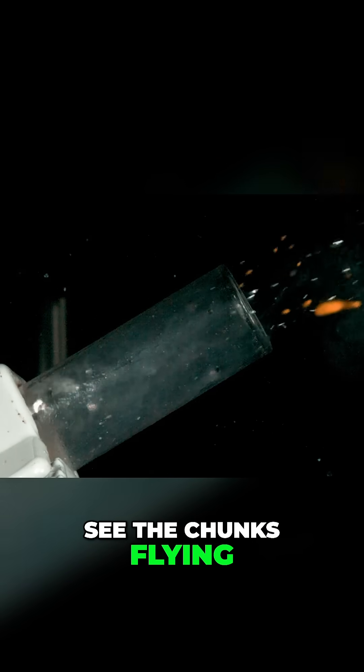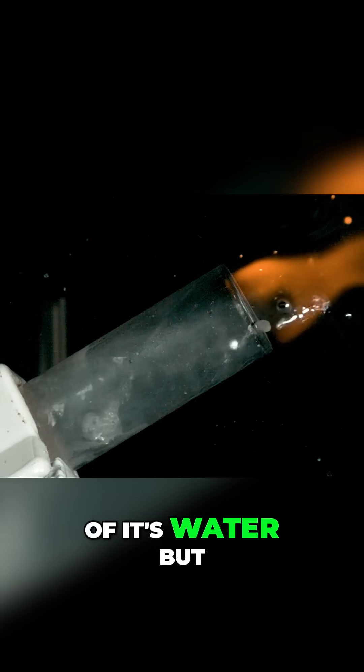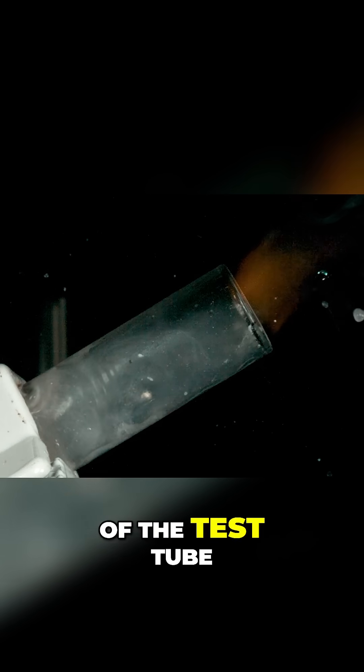You can see the chunks flying out and then the ignition happens. If you look carefully all of that, some of it is water but some of it is molten sodium flying out of the test tube.